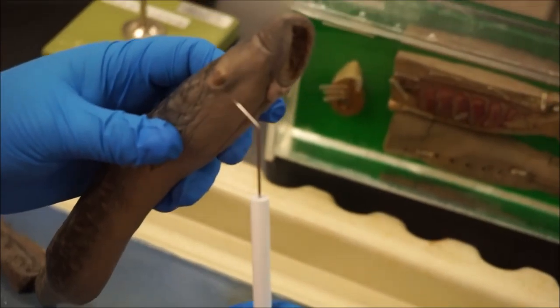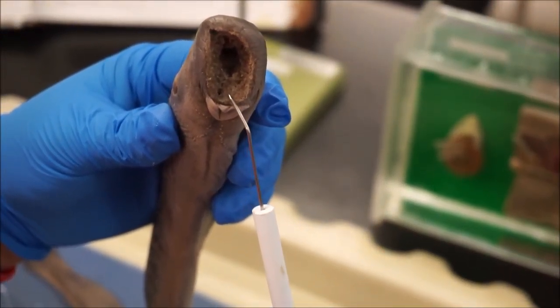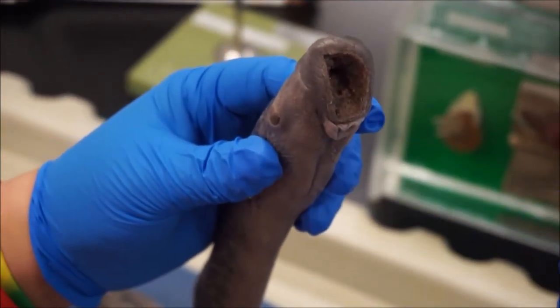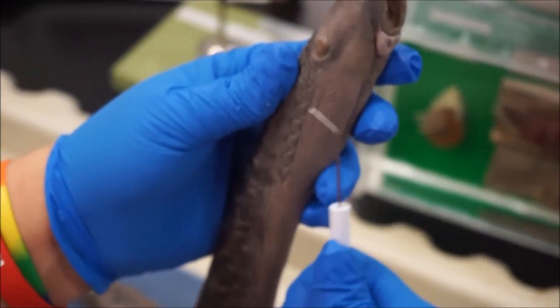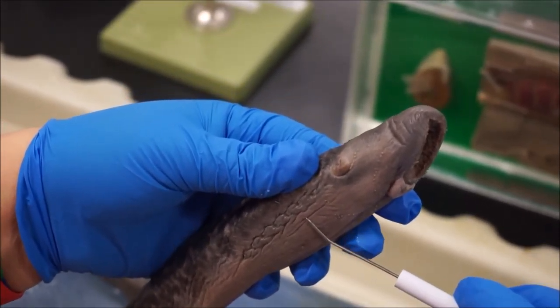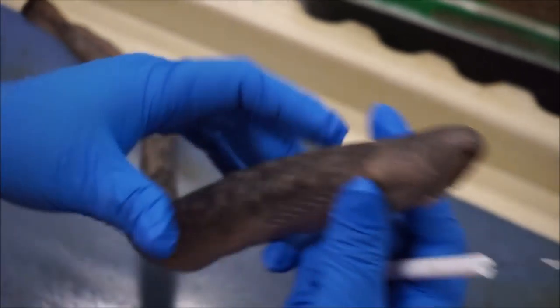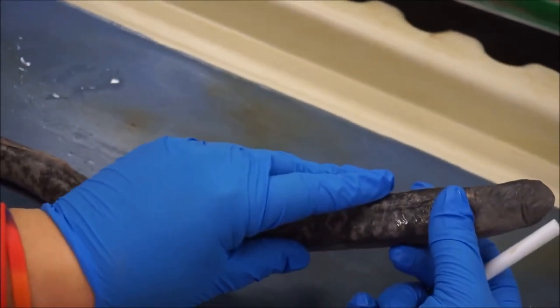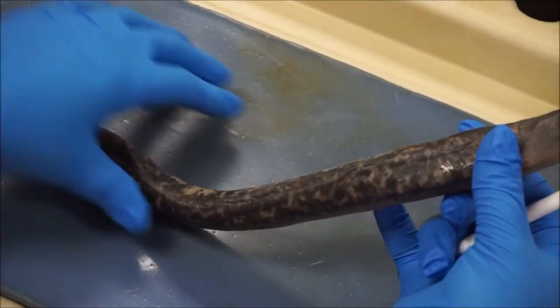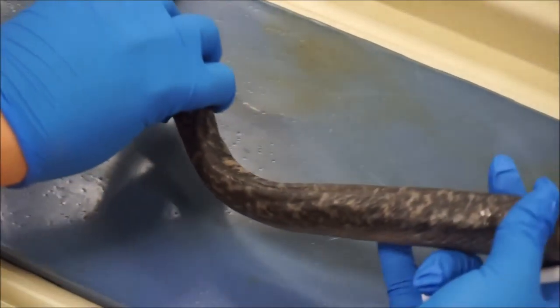That's an eye. Here we have its mouth. These are all of its little teeth that are used for eating when it sucks in water and any little particles or anything that's in the water. And that's when it all comes out of the gills after it eats. When it's not eating, its gills are also used for breathing like other fish. Its skin is very smooth — there are no scales or anything. It helps it swim faster in the water and it moves kind of like a snake through the water.